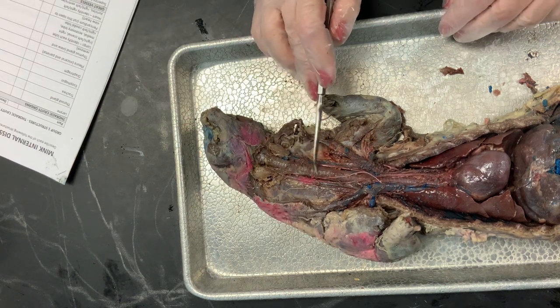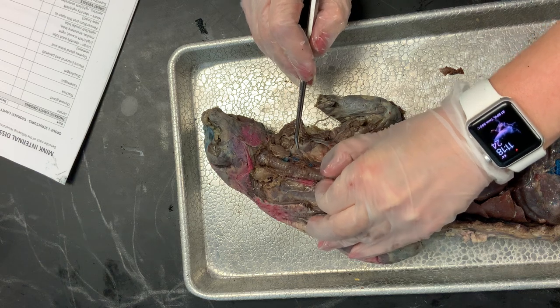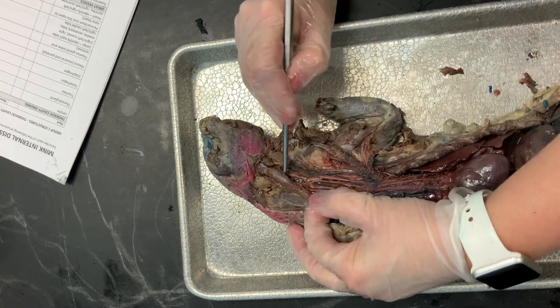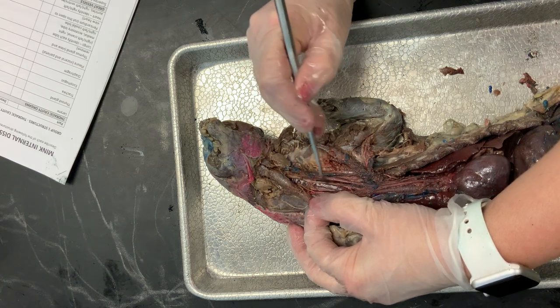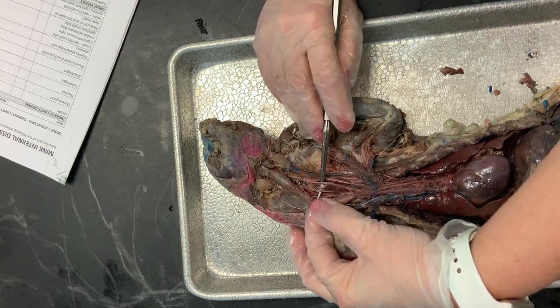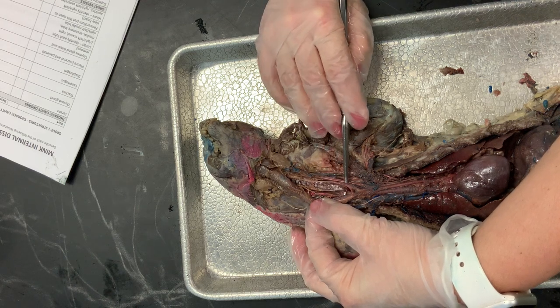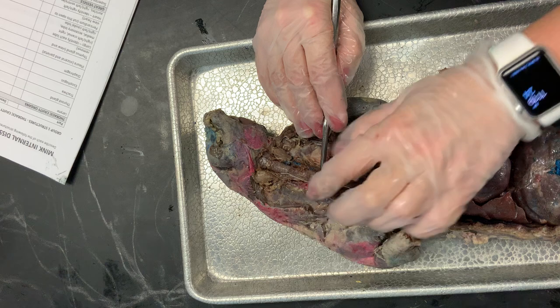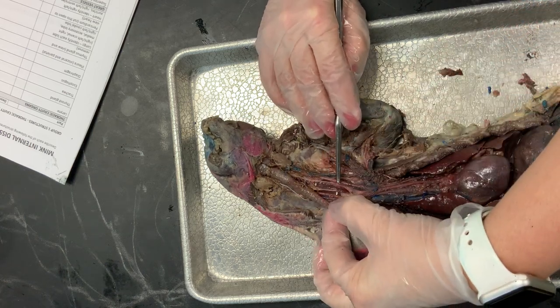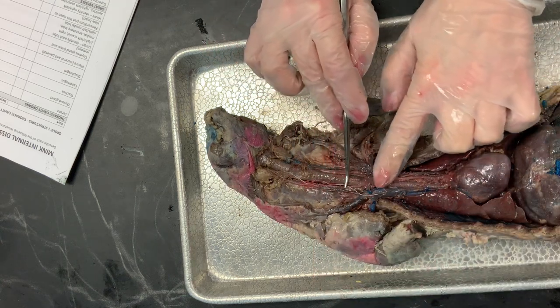If we look behind the trachea, we can see the esophagus. I'm going to grab the trachea and roll it to the side, clearing away some connective tissue. There is a dark, pretty flat tube running up and down directly behind the trachea — this is the esophagus. The trachea lays on top of the esophagus; it's a collapsed tube.